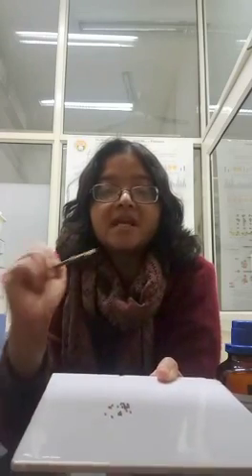Then you just quickly check — yes, so they are ready. I'm just transferring them here. You can see the anesthetized flies. Let me show you with a brush — yes, here's the brush. You can see they are anesthetized quite well.